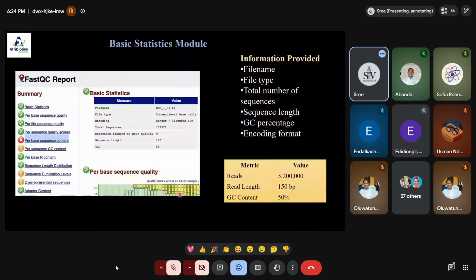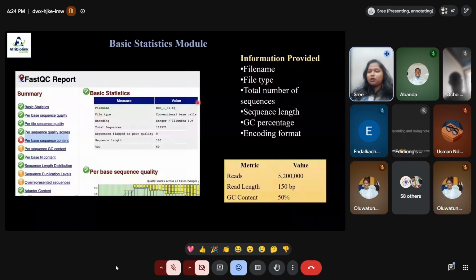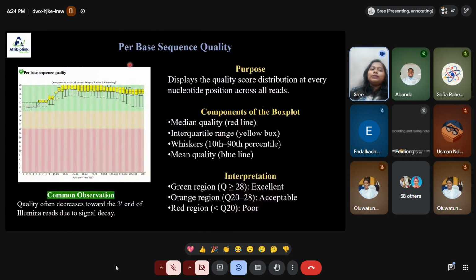So first thing, just have a basic information that is all the basic statistics, which is telling information about these data: what type of data, what the sequence length is, what the metrics are, how the GC content is. All will be information there. And the next thing is called per base sequence quality.